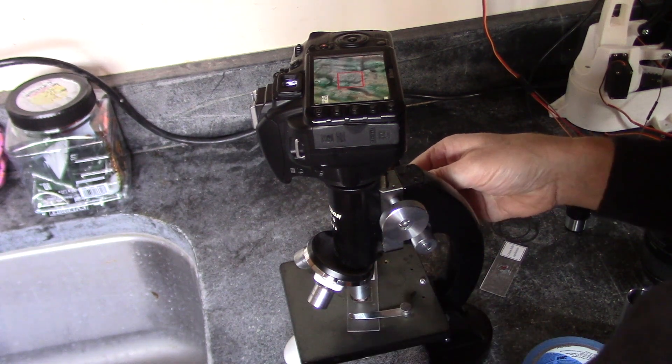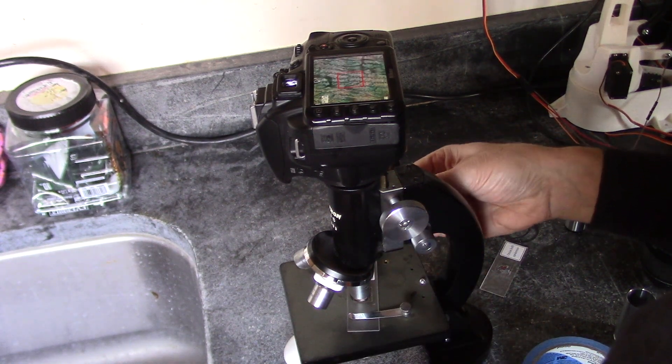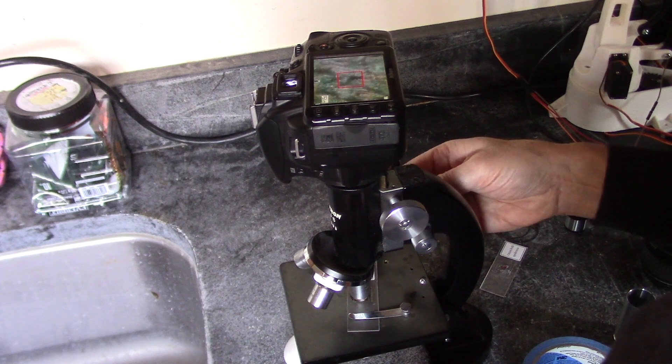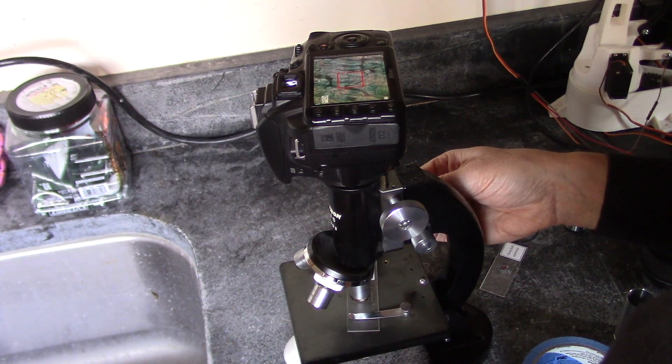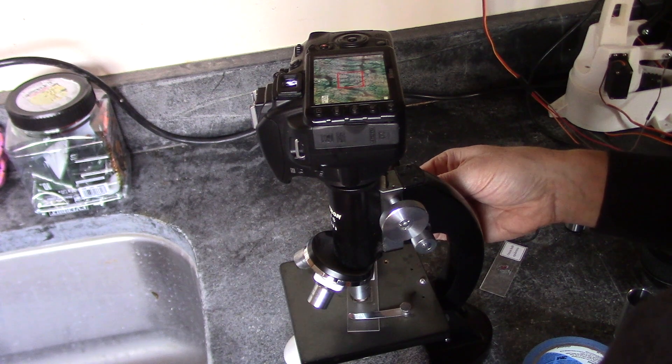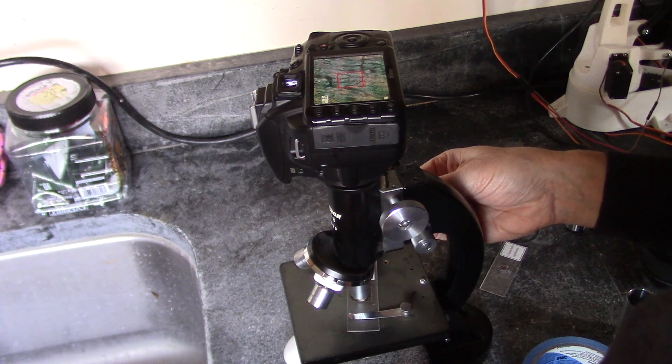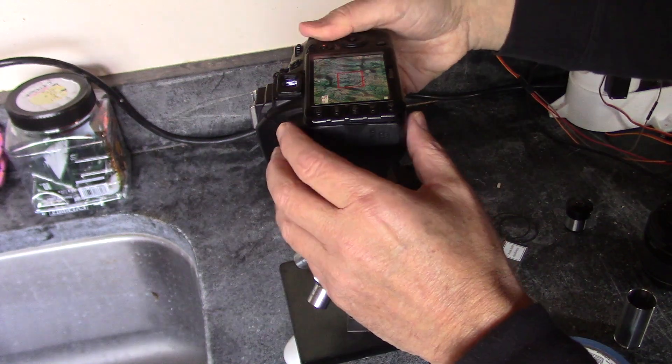And of course, the microscope focuses on different layers, so I'm trying to find the one closest. Let's try this.